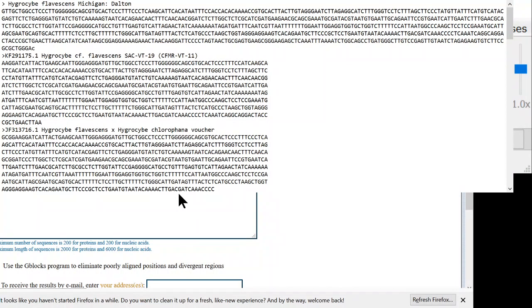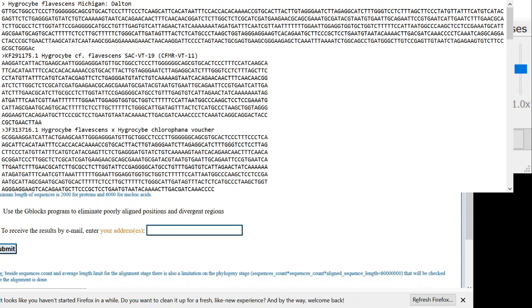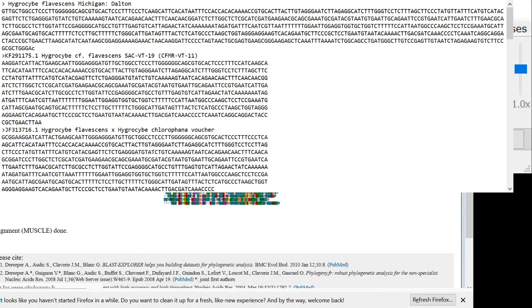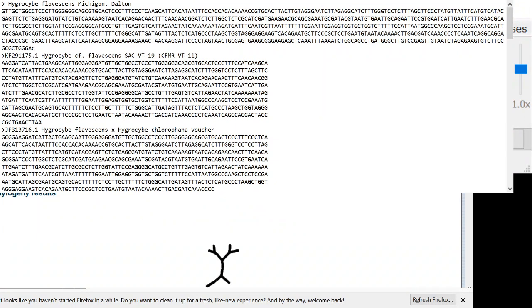So this was called hygrostomi.fas. That's the file that all of my sequences are in. That's the file that has 12 sequences. So we hit submit here into the one-click mode. And what it's going to do now is an alignment. So if you look at this graphic, you see how it's aligning everything vertically. It didn't take long because we didn't have very many sequences. So now it's on to calculating the tree.